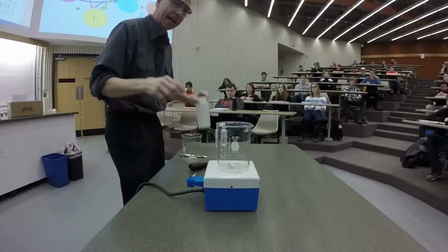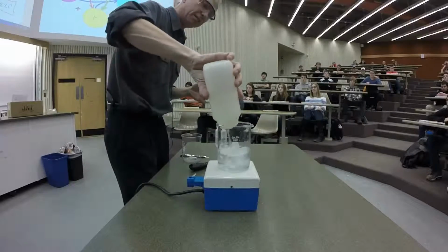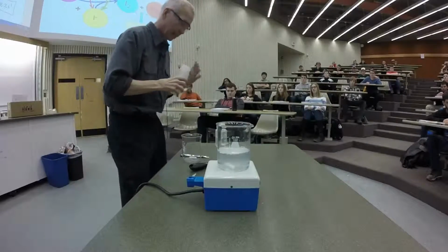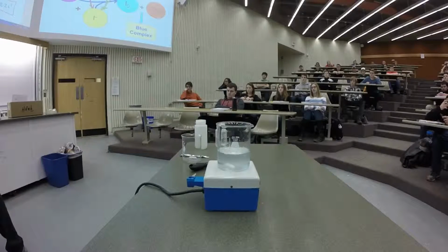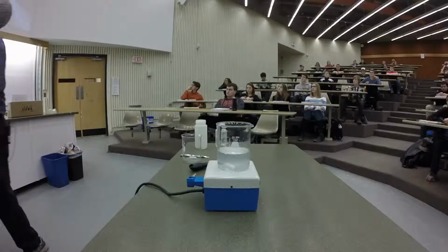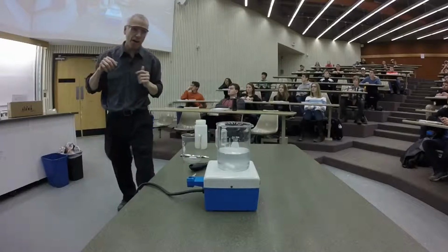All right, so here I have some of my iodate solution. Now, let's get my projections up here. Let's see, and maybe we'll even go here as well. Hopefully we can see what's going on. Hey, there we go. All right.